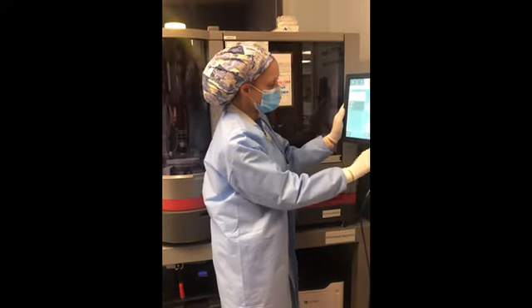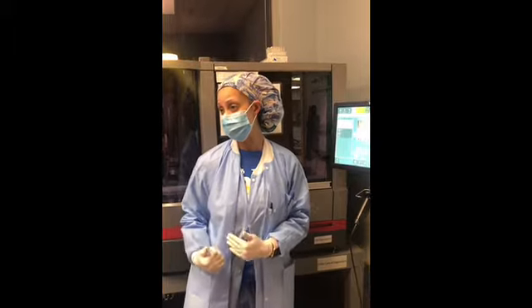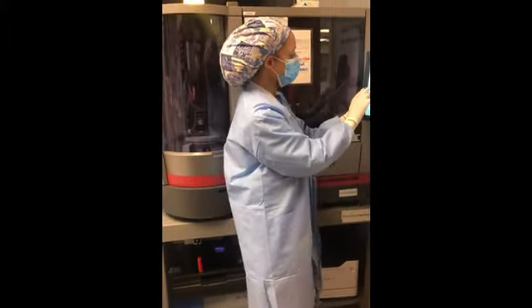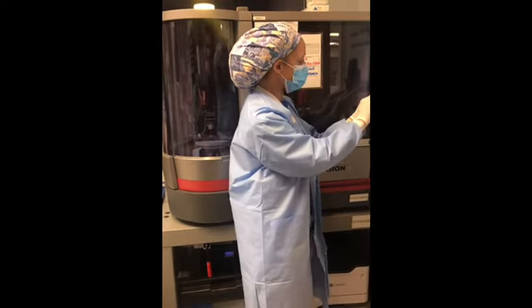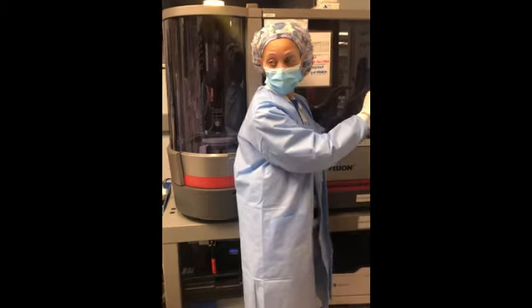Okay? And then you're going to have to send it to LIS. It's not going to send until you send it yourself. Once you press send to LIS, it's going to send it, and you know that it was sent because the same image right here is going to show up in this corner right here.